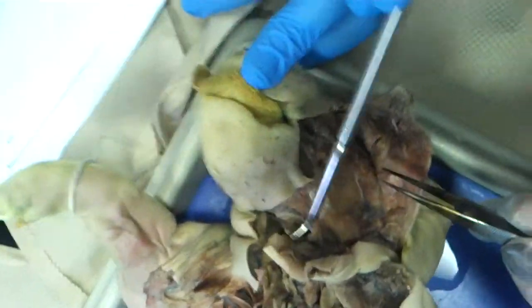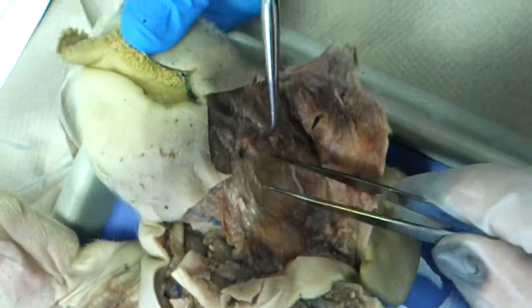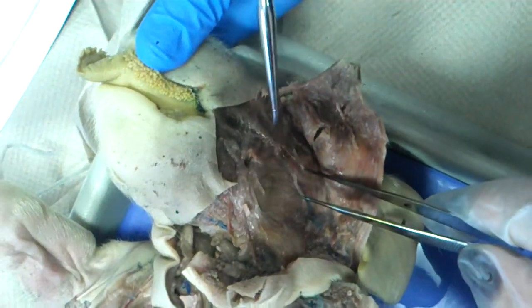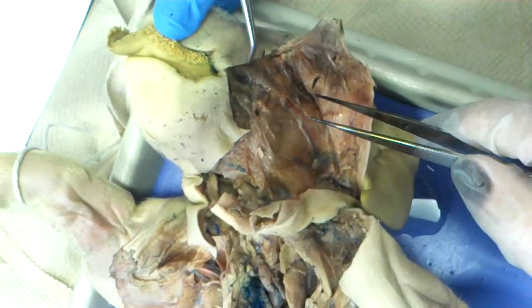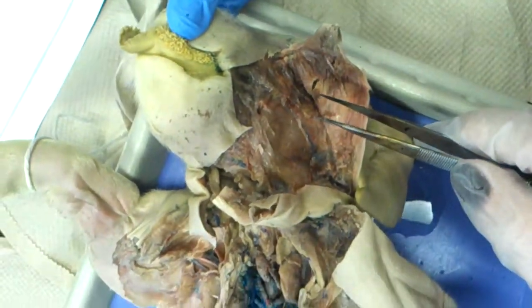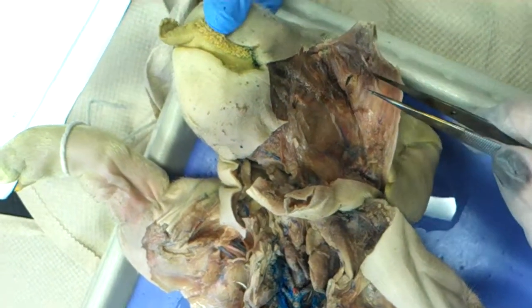This is your parotid, this whole piece is your masseter muscle, duct of the parotid.